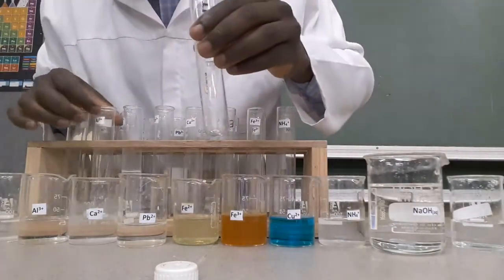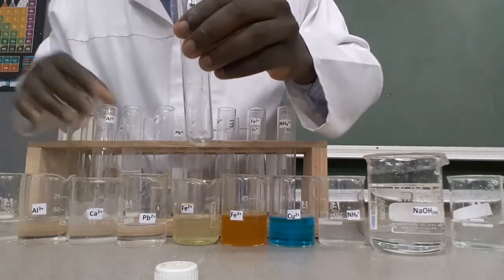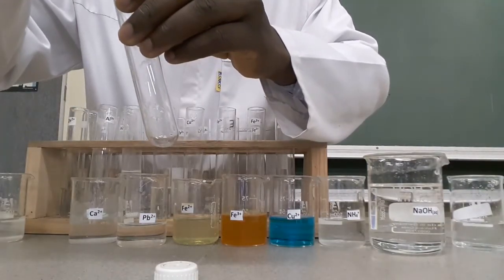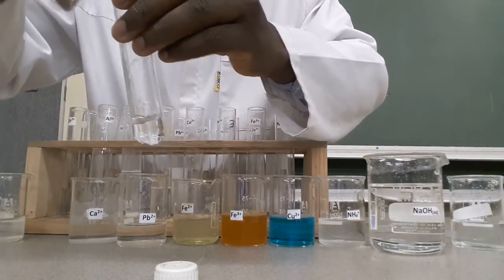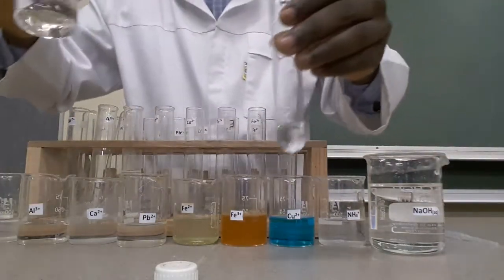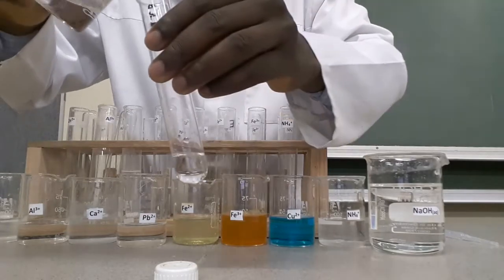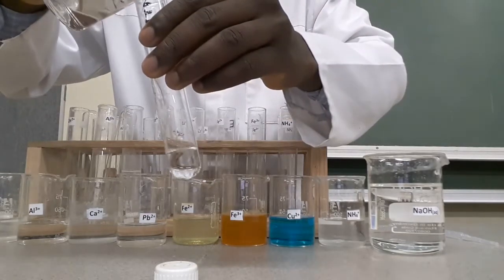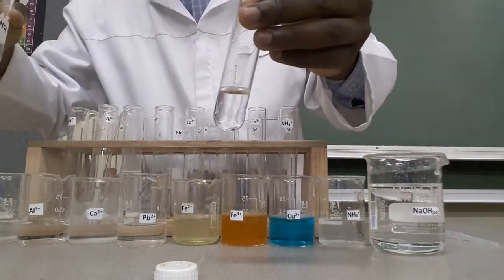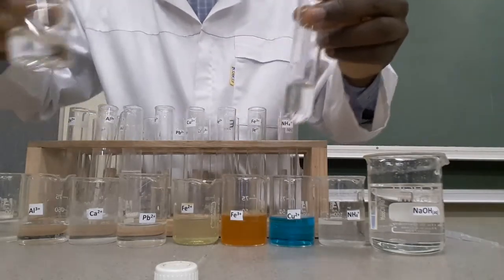Now for aluminium ions: add dilute HCl to find out if you can observe a white precipitate again. There is no precipitation. That's how you can distinguish lead ions from aluminium ions.